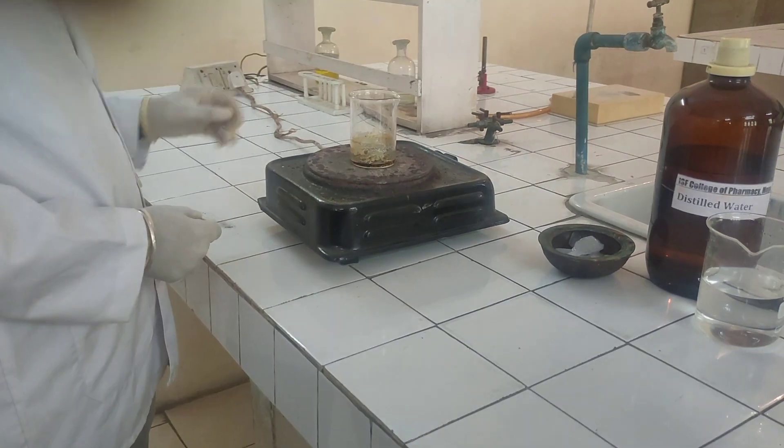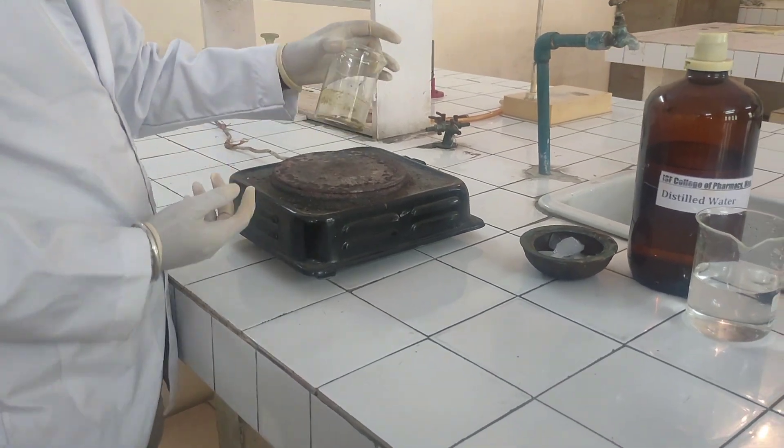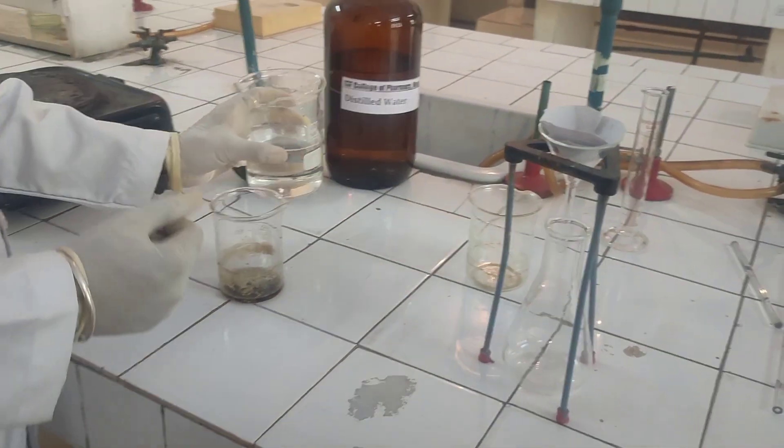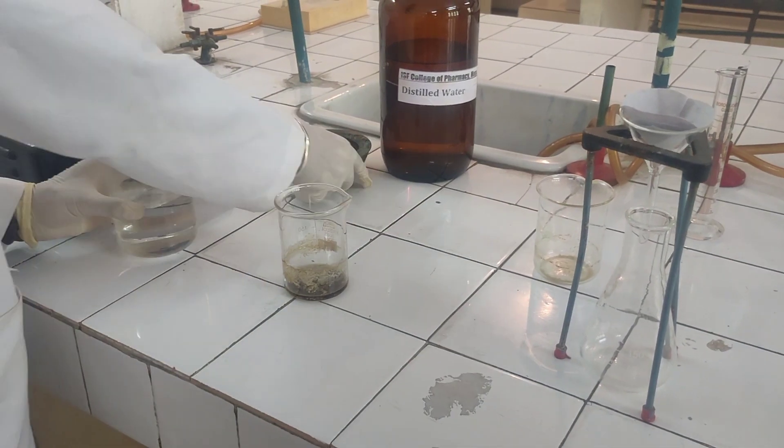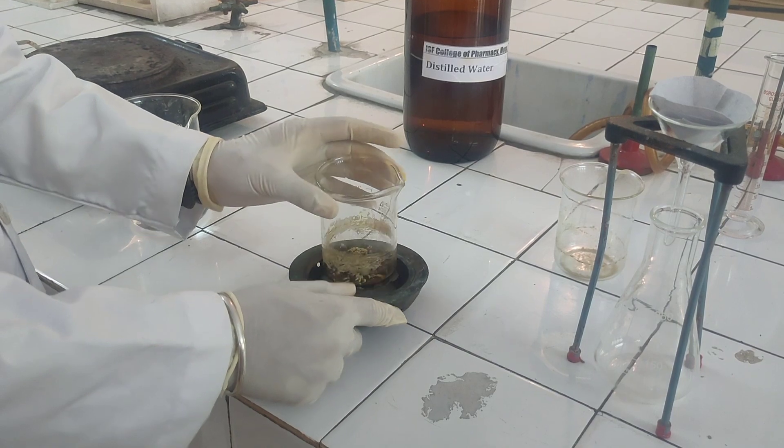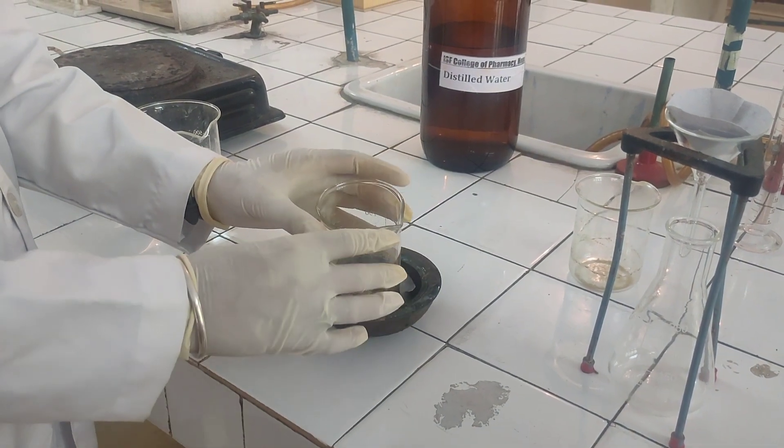When the mixture gets cloudy then take off from the hot plate and cool it on ice bath for few minutes.